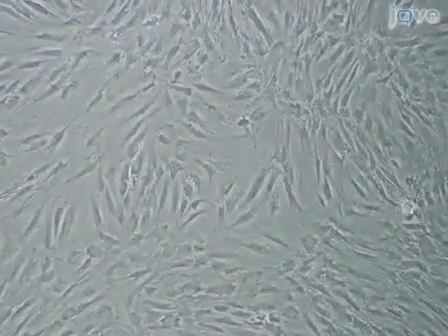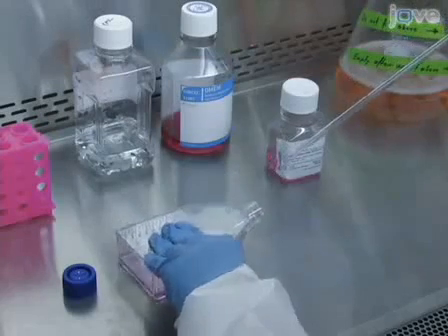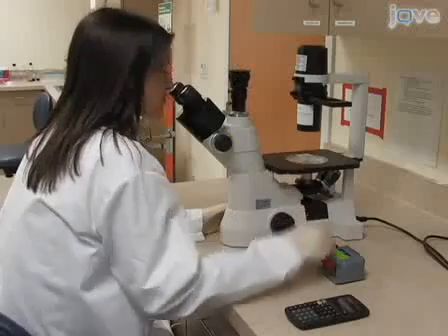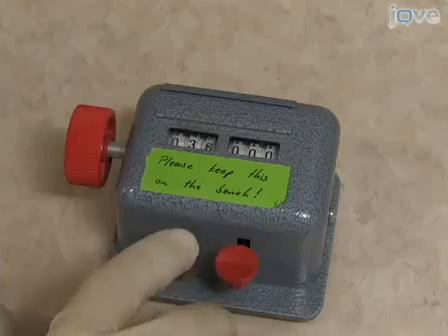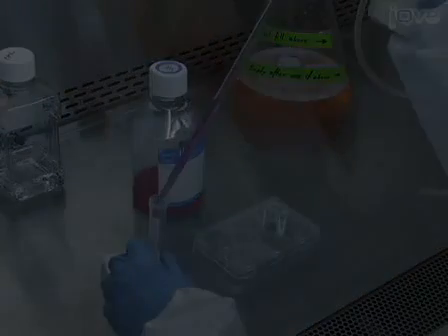To begin the procedure for labeling mesenchymal stem cells, we have to trypsinize and count them to get a suspension with a defined number of cells. Since this is standard tissue culture technique, we will not show it in detail. We want to suspend the cells that we will label at a density of 1 million.